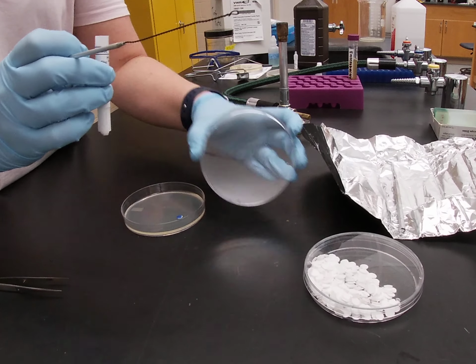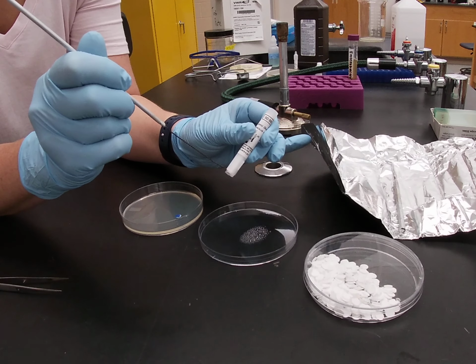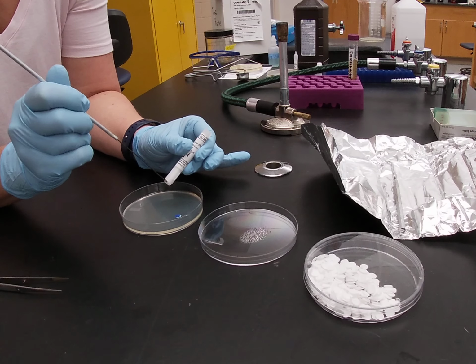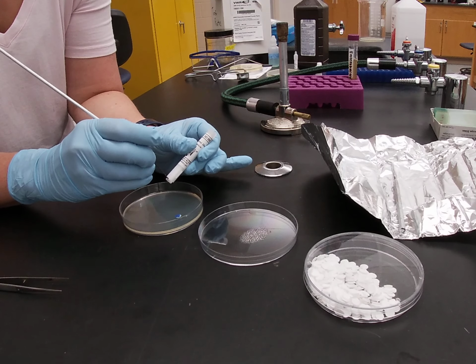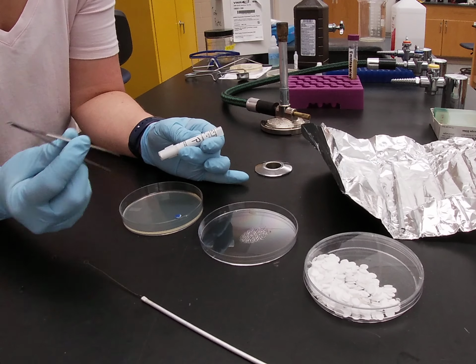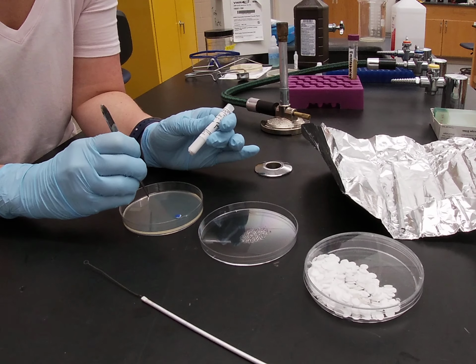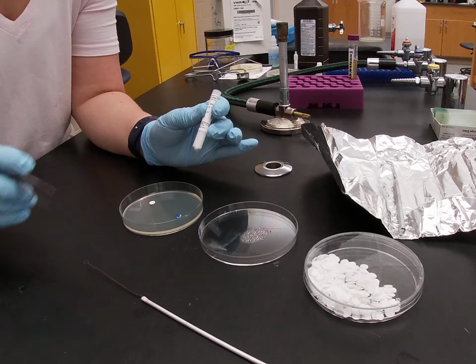You can open up your plate and use the lid of the plate to press out the disc directly into the lid, or you can press the disc directly out onto the plate itself. Sometimes you have to hold it a little bit farther down and just push it out directly onto the plate. Sometimes they don't go easy. You can take forceps and pull it the rest of the way out, and then place it on the agar, and again, just very gently tap it down to make sure it has a good connection with the agar.